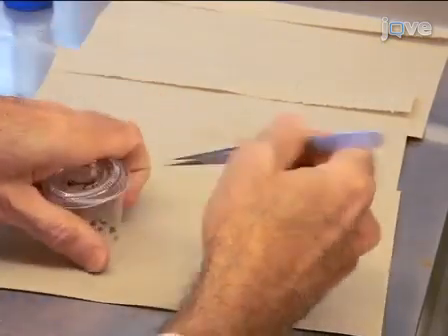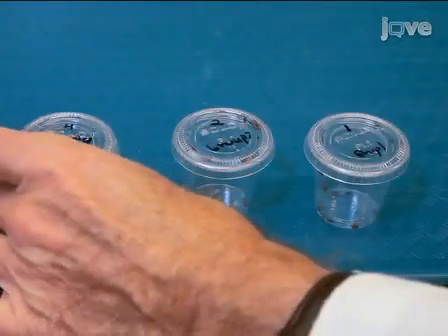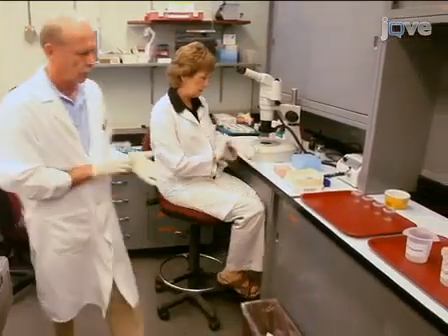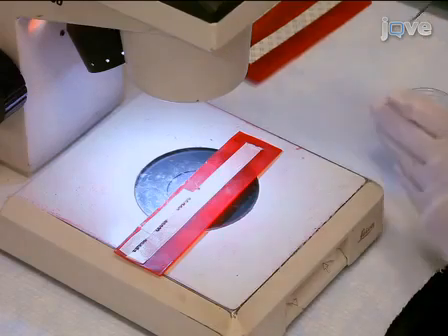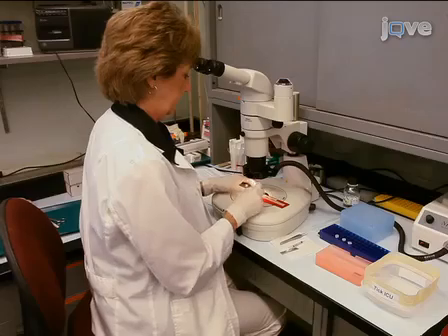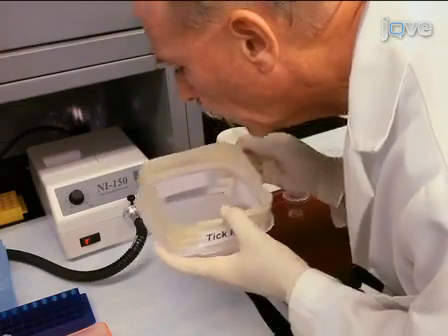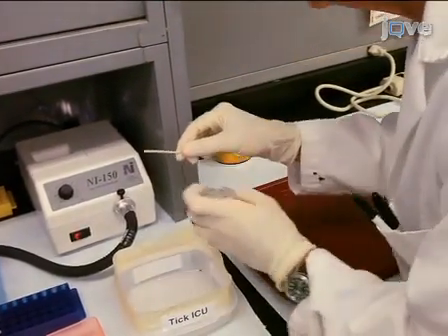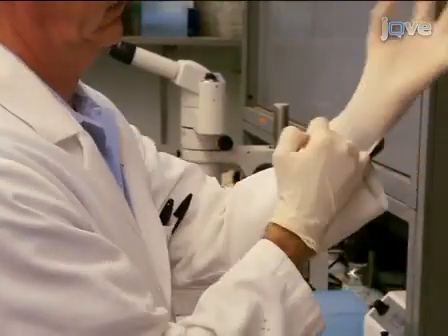Place each group into a 1.25 ounce plastic cup with a tight-fitting lid, and label each cup with the experimental group number. Next, assemble an RNAi team consisting of 3 people that will carry out the injection process. The first person positions each tick on double sticky tape affixed to a 3x6 inch sheet of red dental wax. The second person injects the ticks, and the third monitors the ticks after injection, breathes carbon dioxide on the ticks to activate them, and counts and transfers the living ticks into cups labeled with the experimental group number. All team members must wear disposable gloves.